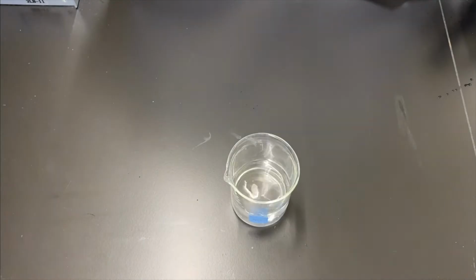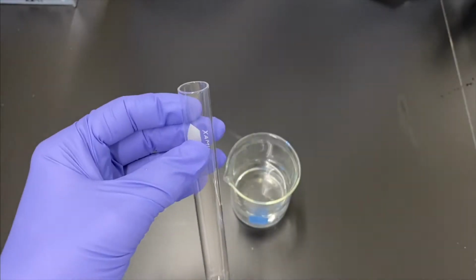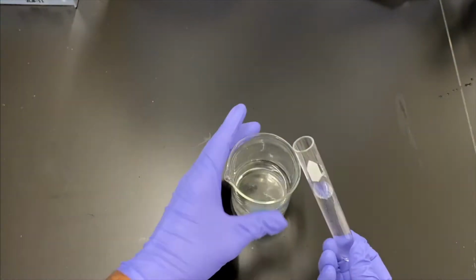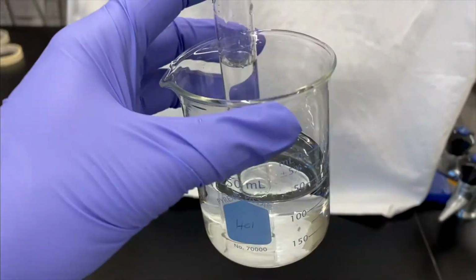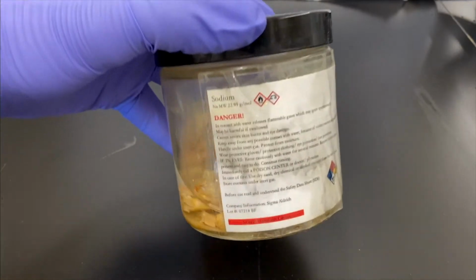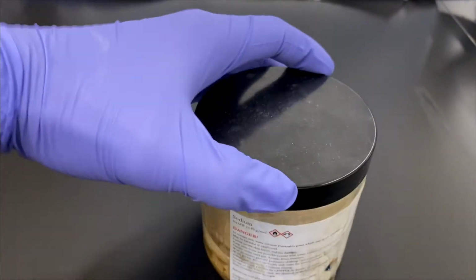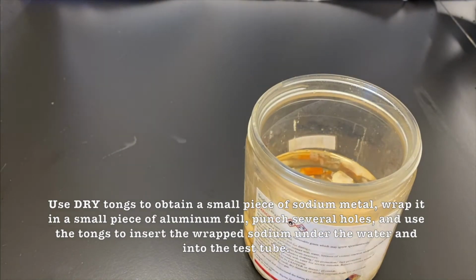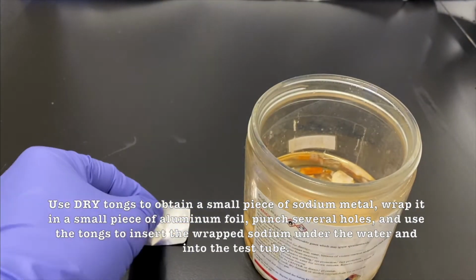Okay, so we're going to do the exact same setup. This time we're going to be doing it with sodium. We're going to see if it's more or less reactive. Okay, we've got our nice setup. Sodium metal we actually keep in mineral oil because it's so reactive that it will just react with the water in the air.